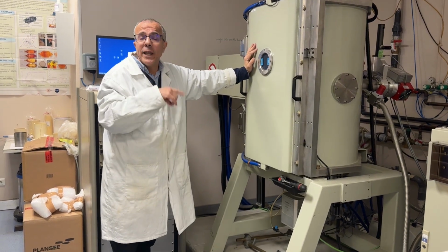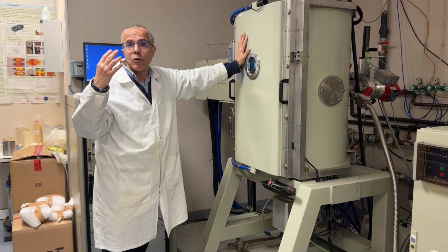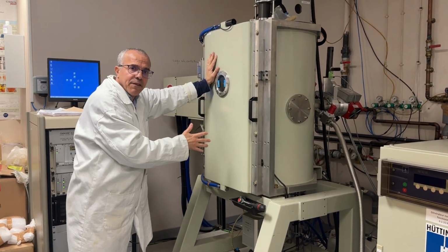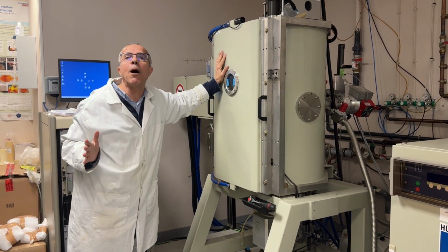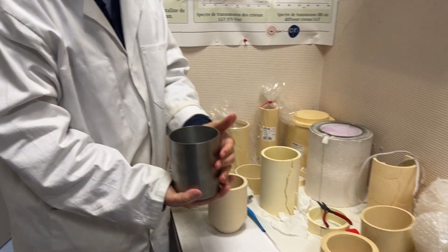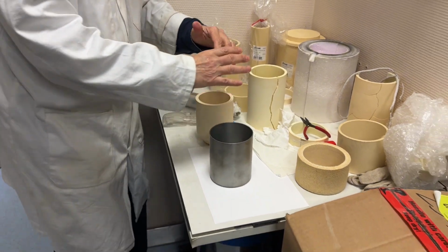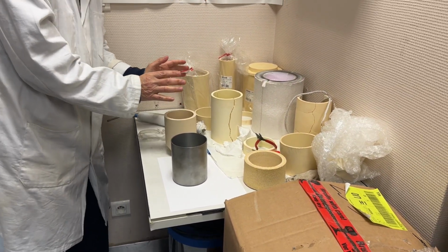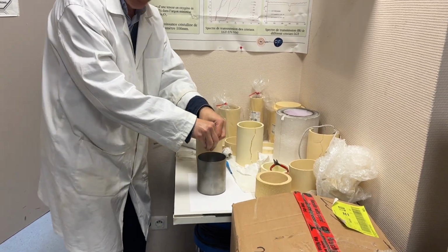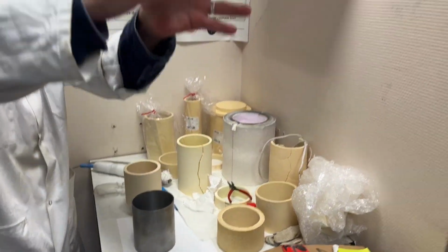and also we can heat the crucible and grow GAGG, sapphire, LYSO. As we are using an RF heating source, we have no limit of power. Please see here, for example, the crucible that we are using to grow bulk crystal, and you see here we have all the heating zone, all the ceramic construction around the crucible. And for example here we put the raw material, then after that we put the crucible inside the chamber.